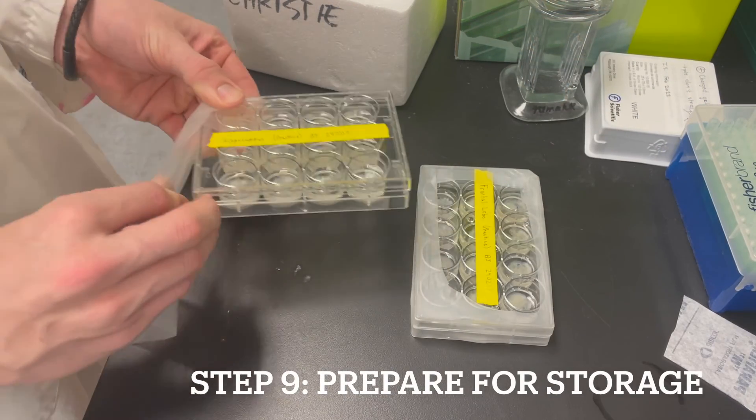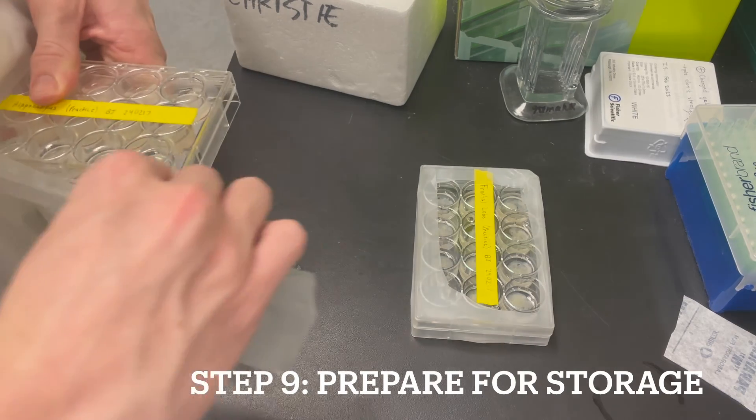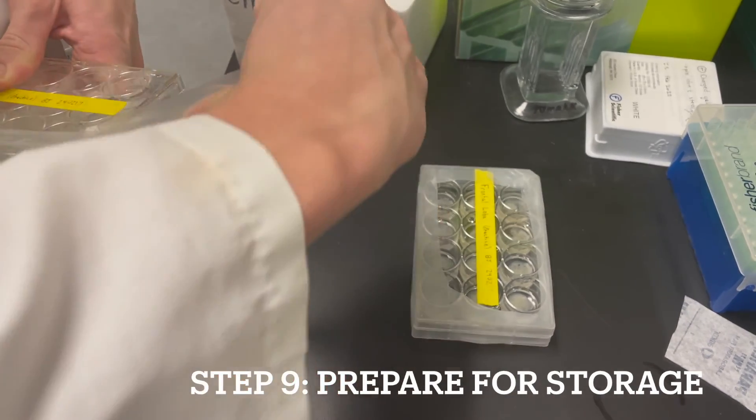We'll finish off by covering our well plates with parafilm and place them in the four degree fridge for storage.